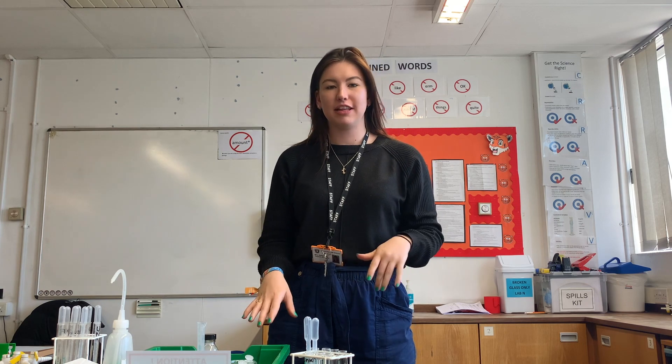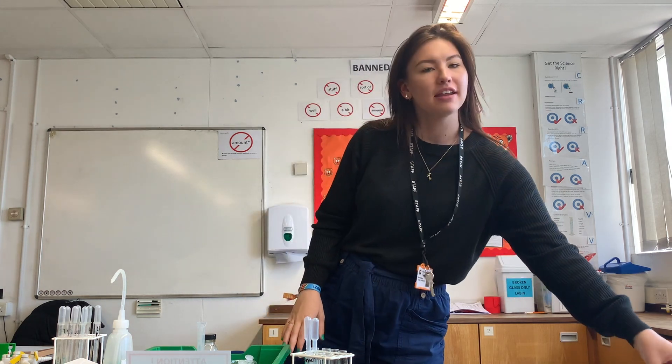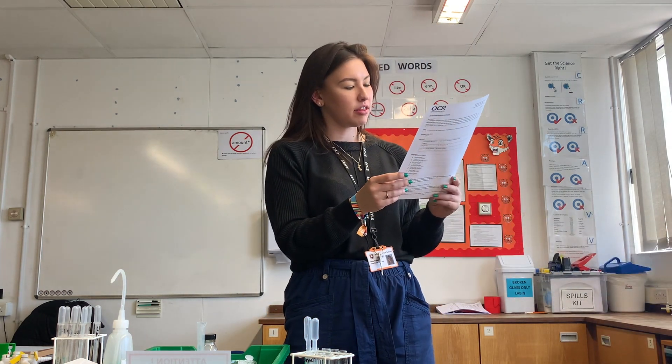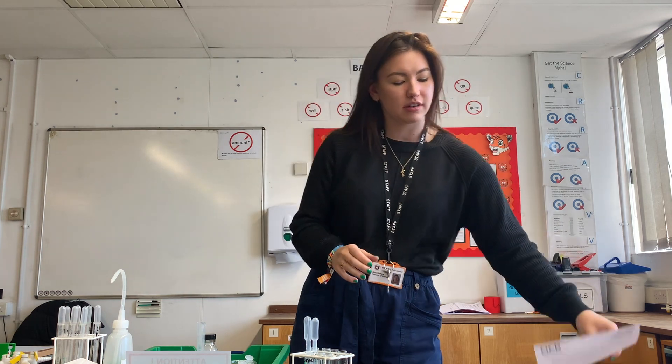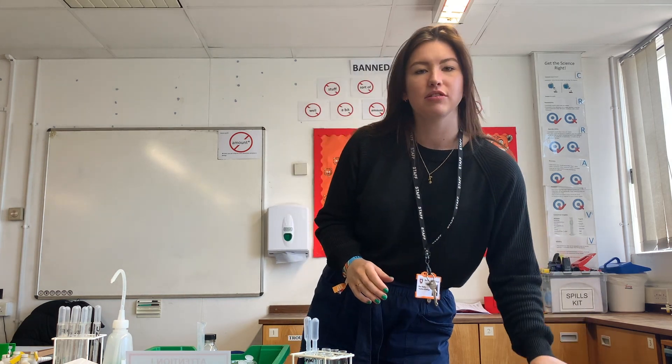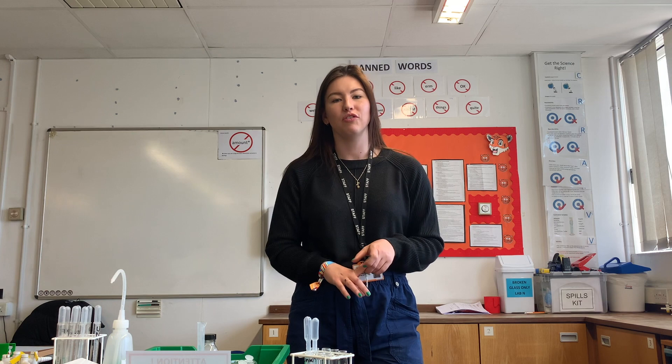The only thing left to do now is to tidy away the practical equipment. At the end of the instruction sheet there are three extension questions to answer, which make you think about what we've done and why - which will help you in your written exam.